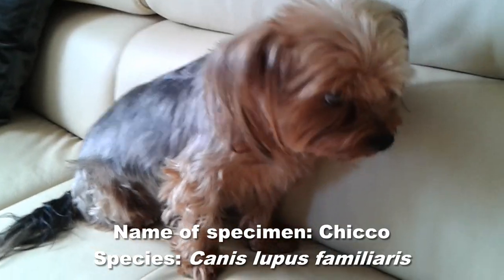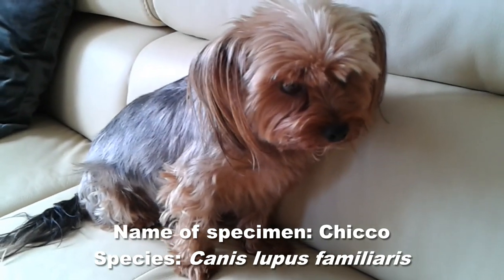So hello and welcome. Today I'm going to put a dog under the microscope and I'm also going to show you how to do the specimen preparation because a dog, like many other mammals, are generally too big to be directly microscopically observed. So what you have to do is prepare the specimen and bring it into a form which is sufficiently thin and also small enough so that you can mount it on a microscope slide. I'm going to show you now how to make a permanent mount of Chico the dog.